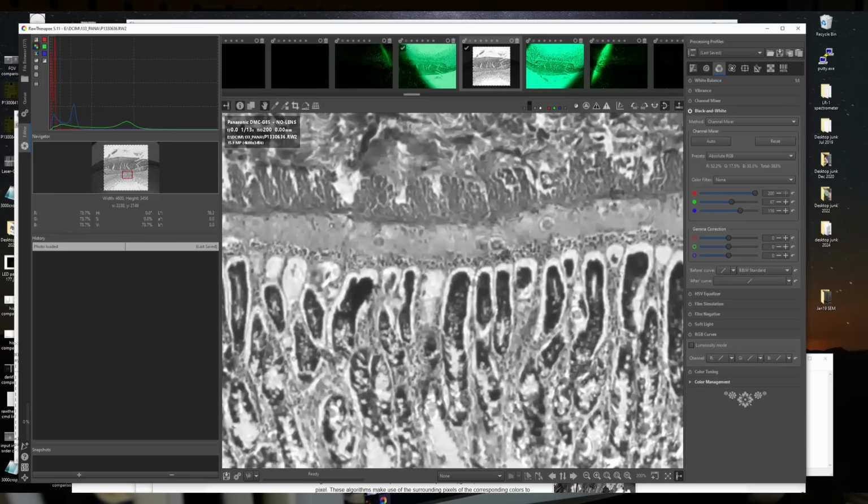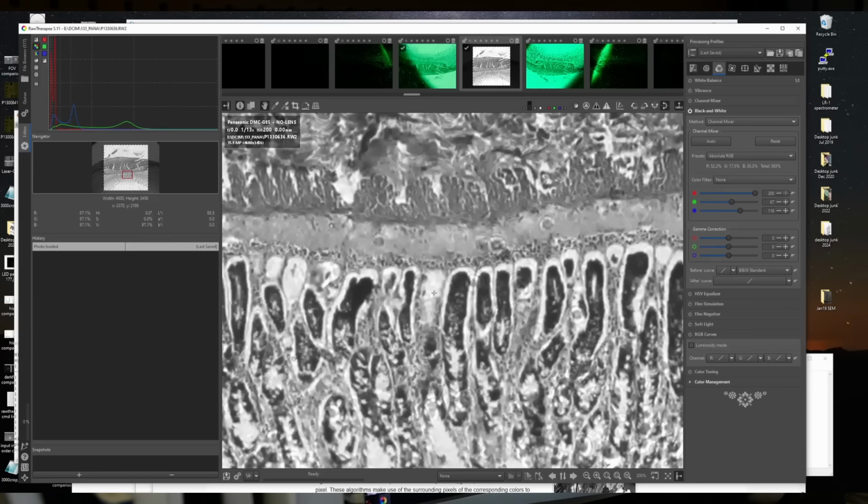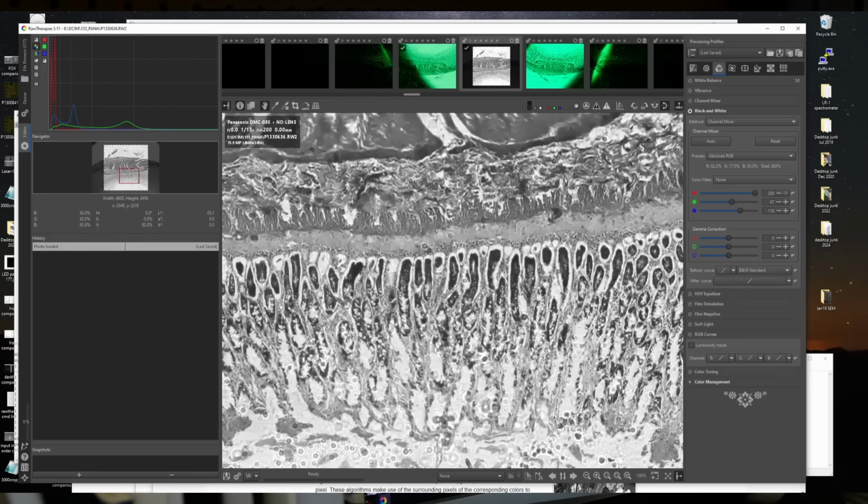So again, if you're going to try this, you've got to get a hold of a scientific CMOS camera that has a monochrome image sensor. So anyway, I used this program called RawTherapee to take the raw images from the camera, apply this color correction, and de-Bayer it, and save these as TIFF images for import into the Octave script, which does all the work.